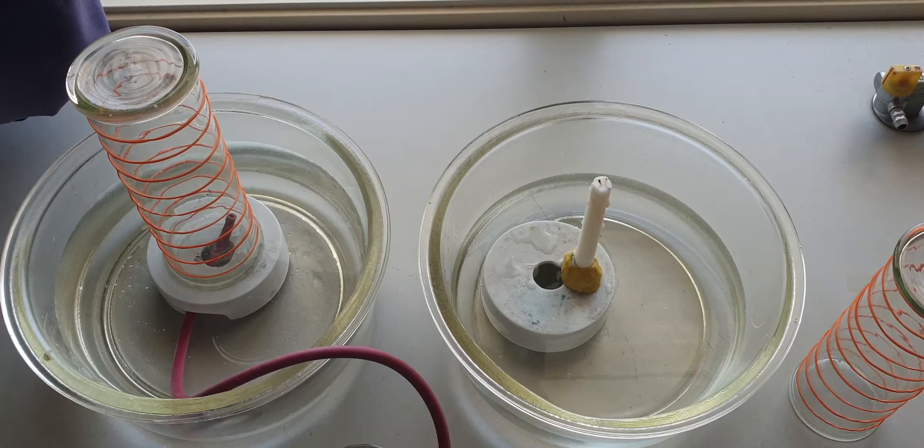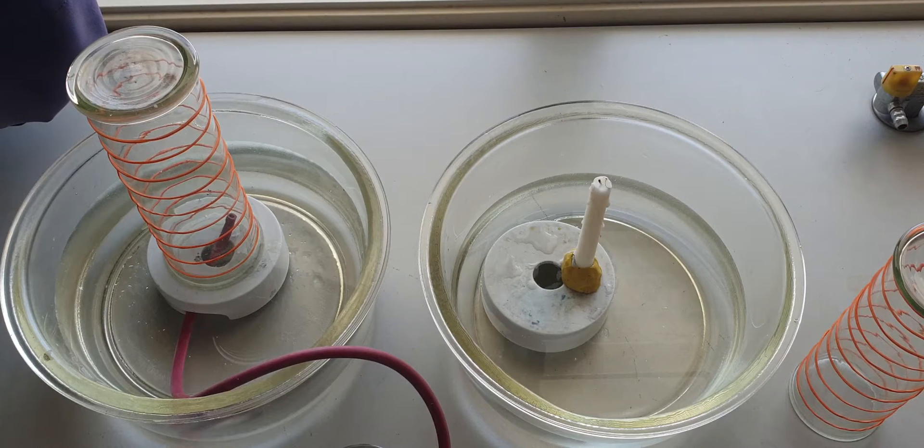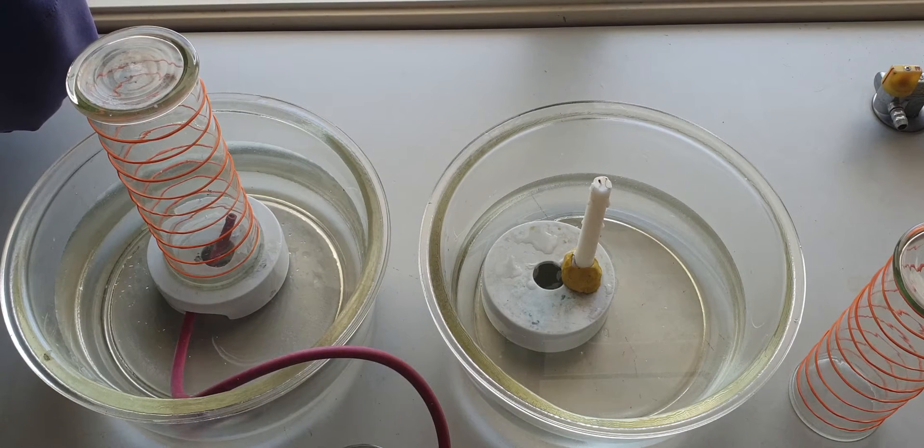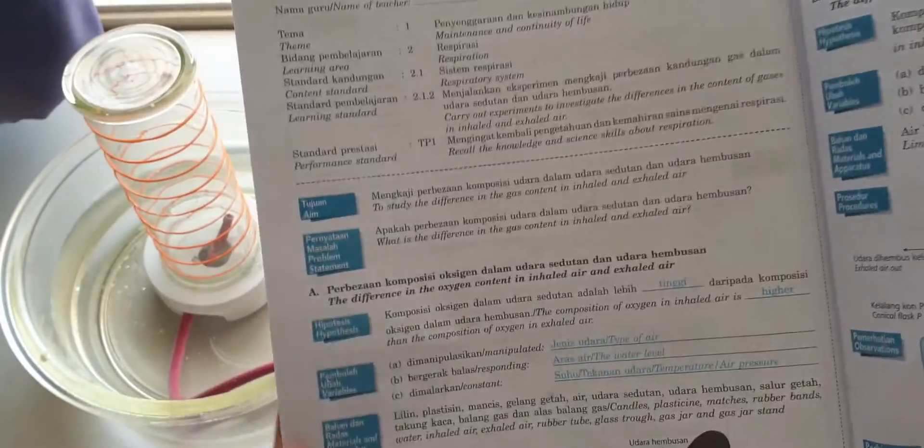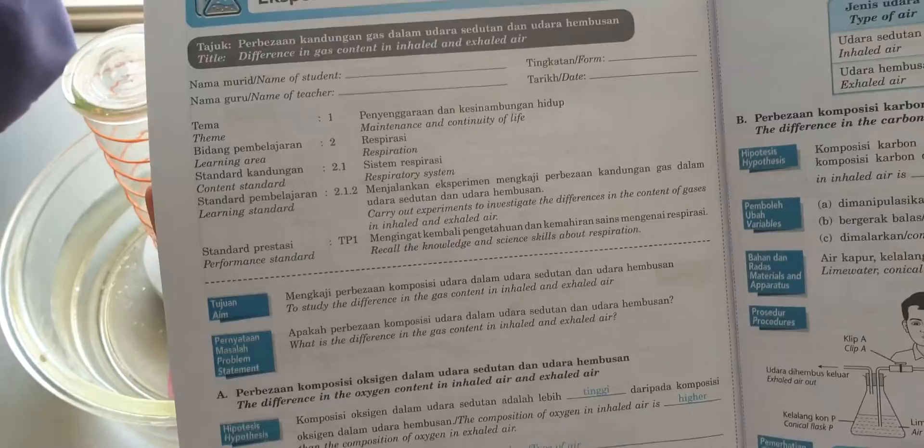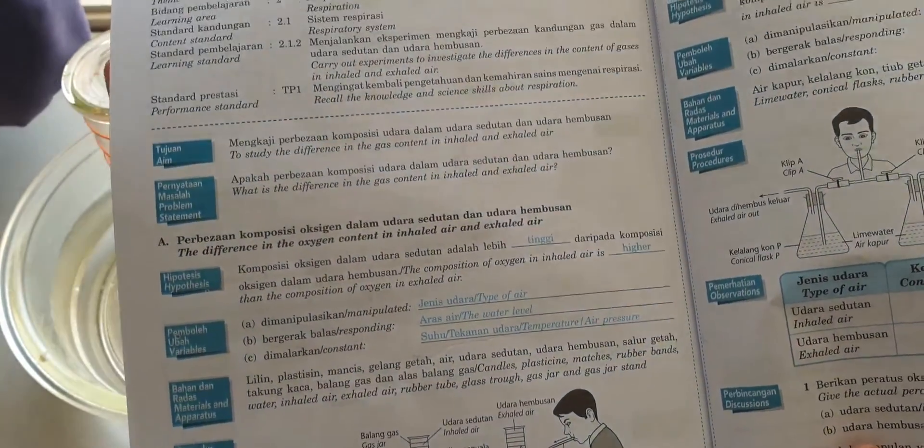So you have learned about respiration that happens in the lungs, but I'm going to show you how we're going to compare the composition of the inhaled and exhaled air. We did this experiment, so this experiment is wajib. This is what you are supposed to do last week if you came.